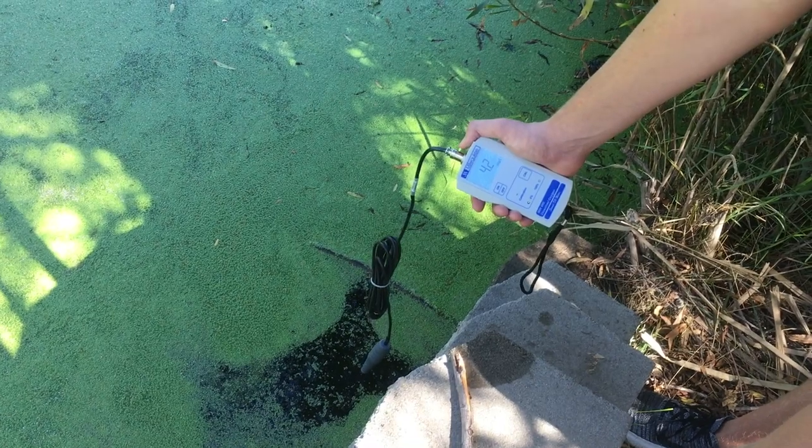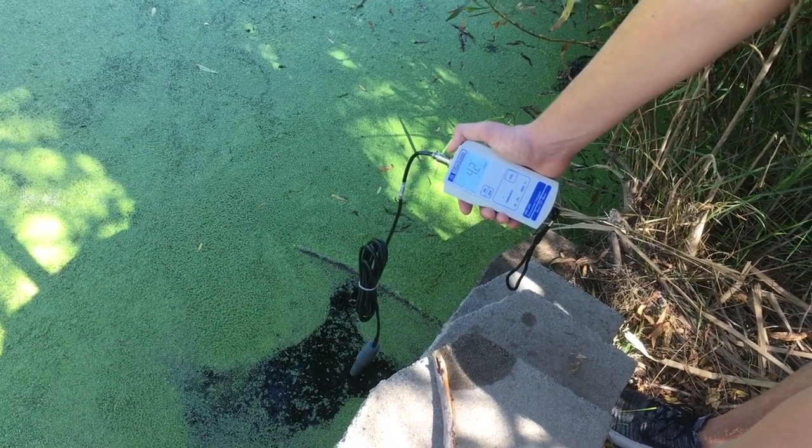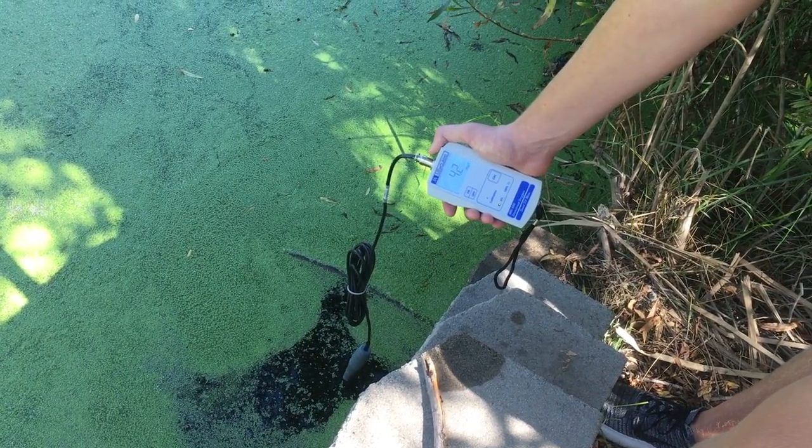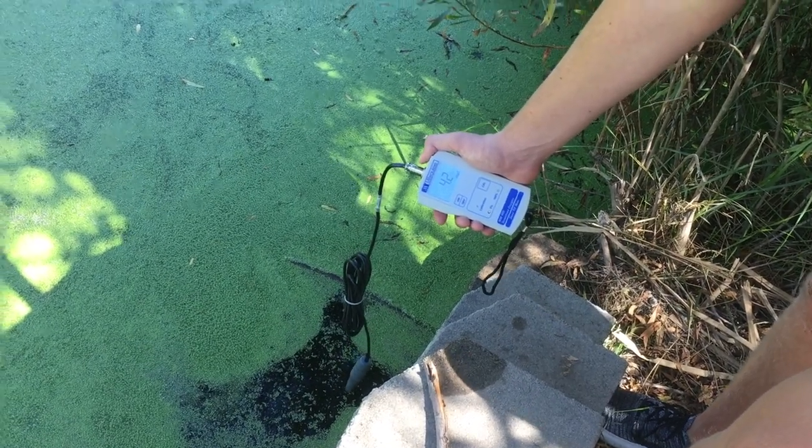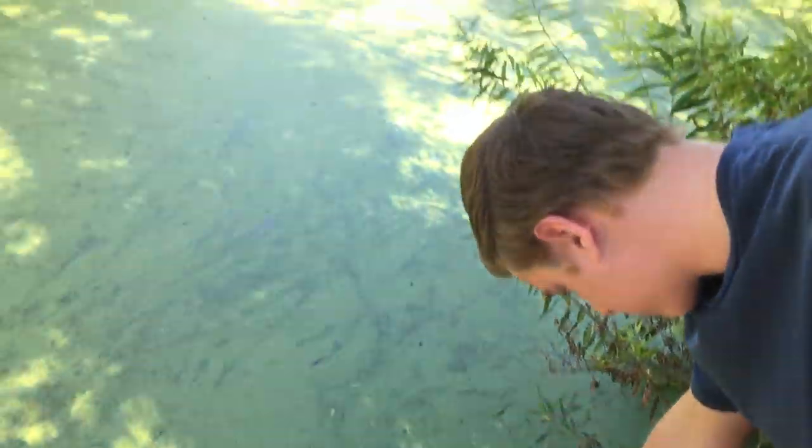Alright, here we are at the duckweed pond, waiting for the reading for the dissolved oxygen. It's at about 4.2. Here's the pond.